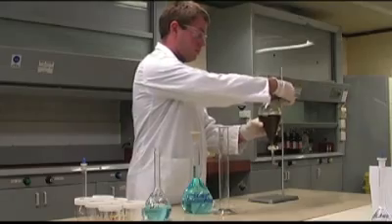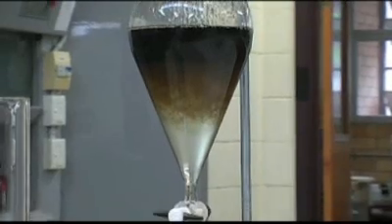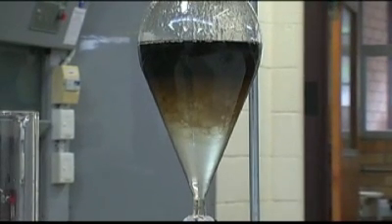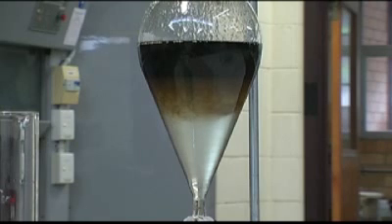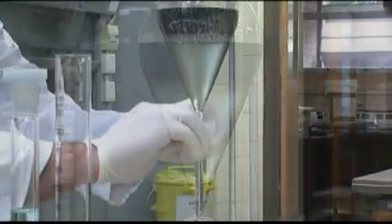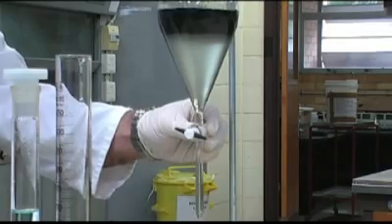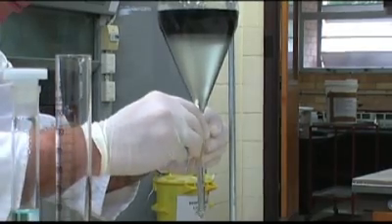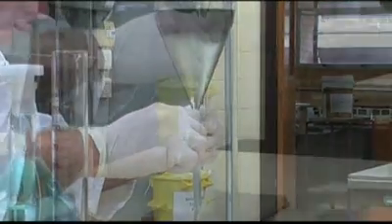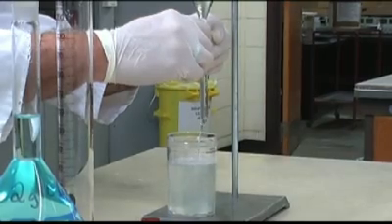Now we allow the phases to separate, and this will take approximately one minute. It changed colour and formed layers. When the extractant molecules come in contact with the copper cations, they form a complex called a chelate. The chelated species is soluble in the kerosene and not the aqueous layer, so when the two immiscible liquids are allowed to settle, they actually separate out. The raffinate can then be siphoned off, leaving behind the organic phase that is somewhat enriched in copper.